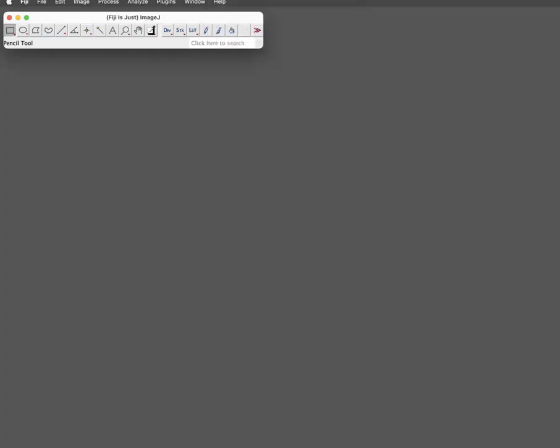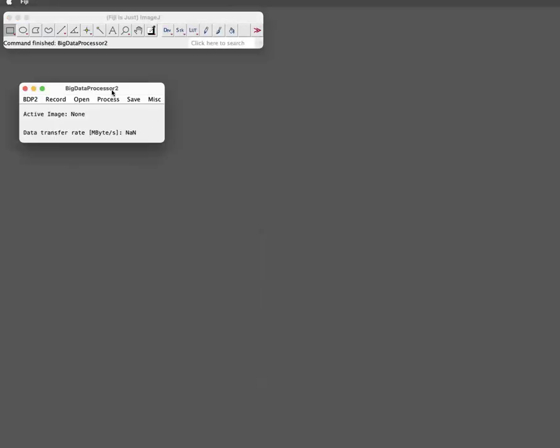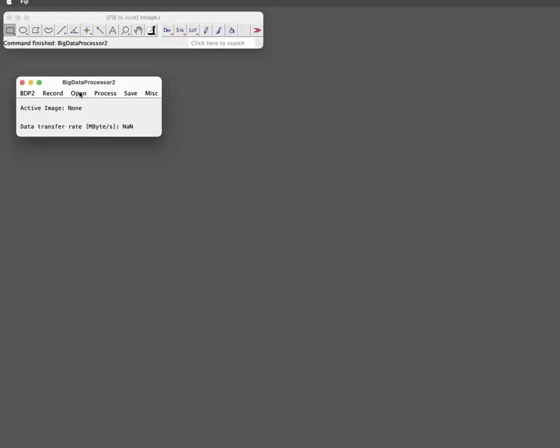So once you have that installed, then in Plugins, you can open BigDataProcessor, and for this it's important now for the drift correction to open BigDataProcessor2, which is anyway in general the one I would recommend using. So now we open a file. There are many supported options. In this case, it's a TIFF stack.